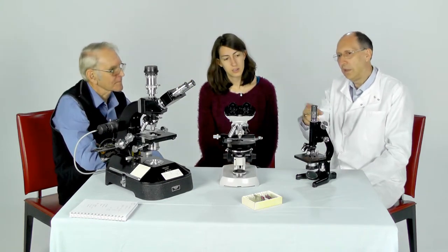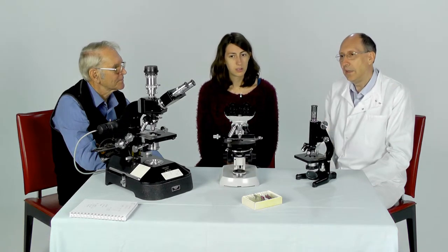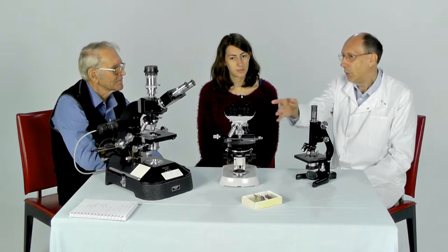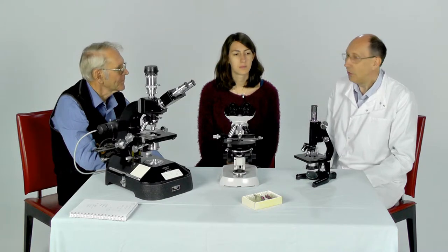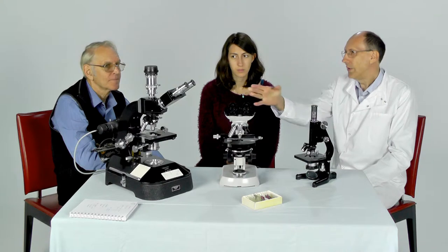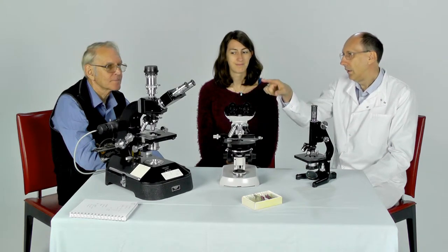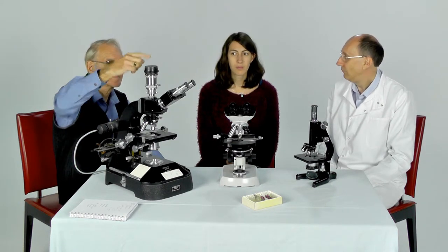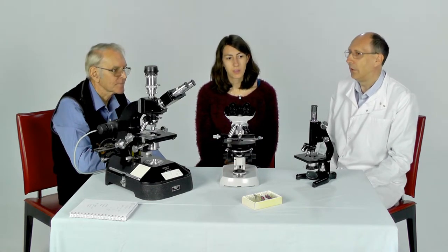The other thing worth mentioning is you can either have one eyepiece linked to the lens system, or, as demonstrated in other videos, you can have a binocular system where you're using both your eyes as you look at the sample. And on some microscopes you actually have a trinocular head, where the additional head, apart from the eyepieces, is for the camera, so you can attach a camera to do photography.